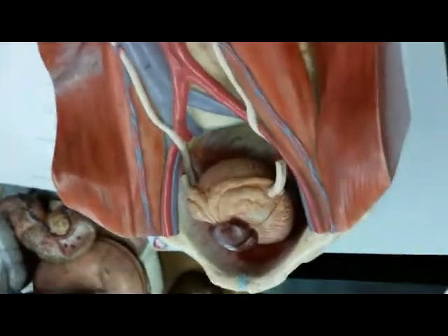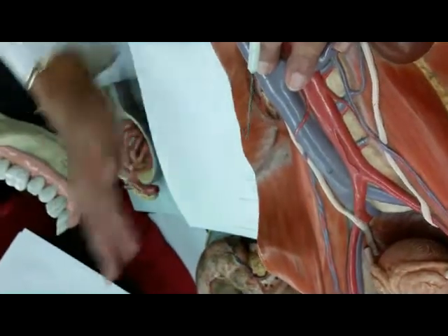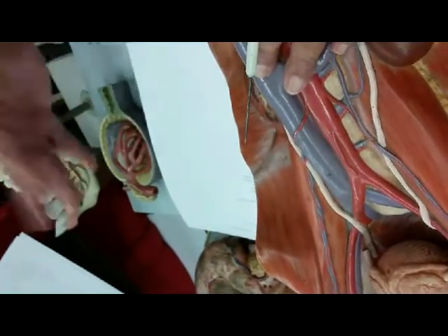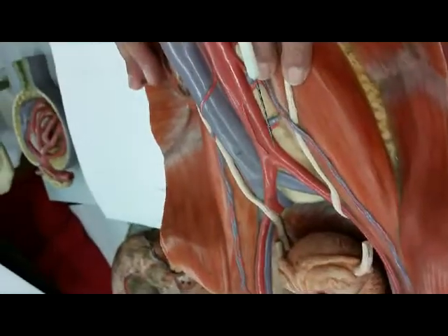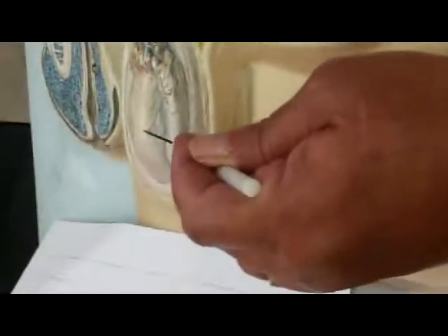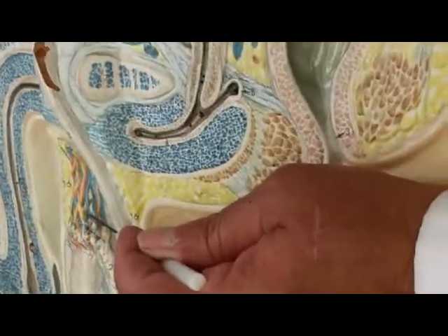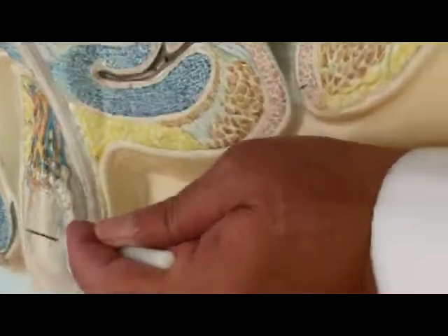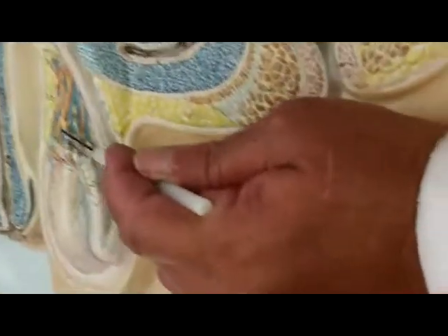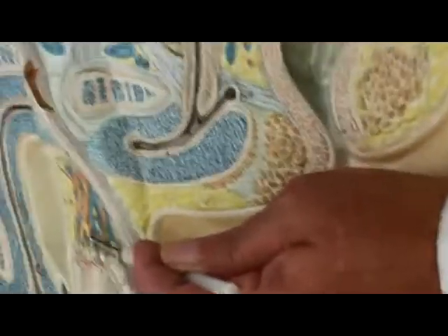So again, any questions on the kidney? Any questions on the urinary system? So now we go to the fun part, the reproductive system. Let's turn over. Attention, that is the scrotum out there, and this represents what? The testis, and right on top of the testis is the epididymis. So sperms are made here, and they go to the epididymis where they mature and are stored.